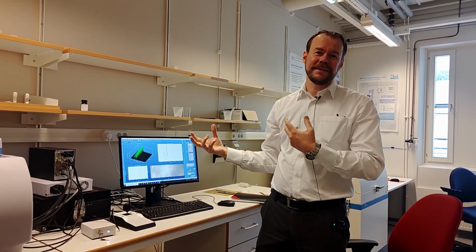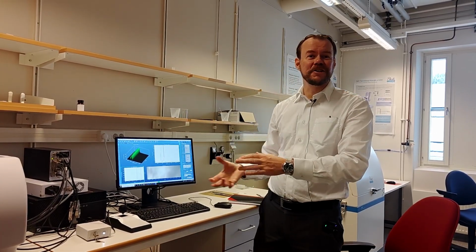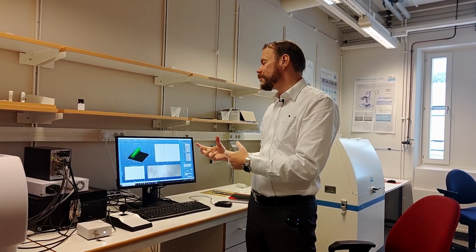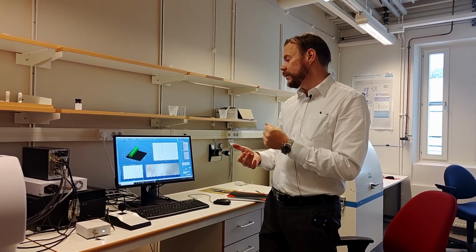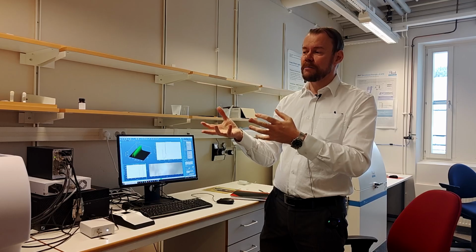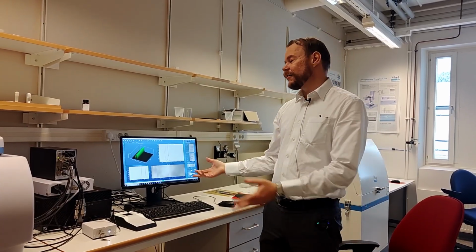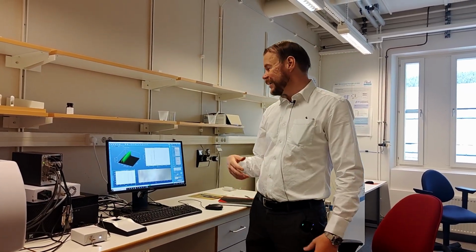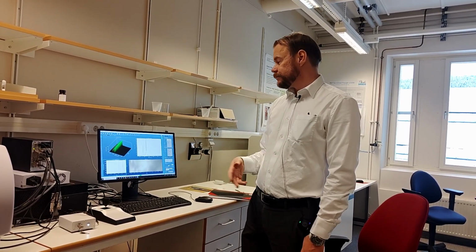And if each spectra is a few seconds, then you're talking hours. So it's not really realistic to scan high resolution, 3-dimensional volumes if you don't optimize the spectra so you can take them really, really fast. And to take spectra really, really fast, you need a sample that gives you a strong signal. But if you don't have a sample that gives you a very strong signal and you need to scan for a long time, then you are like a sitting duck here. You can't really come so much further on that.